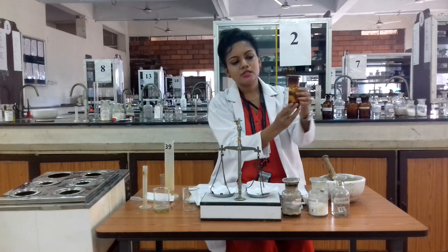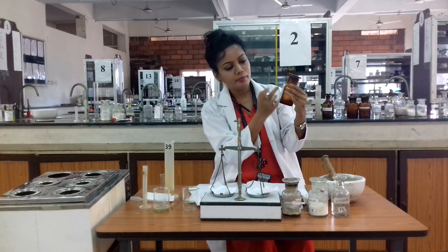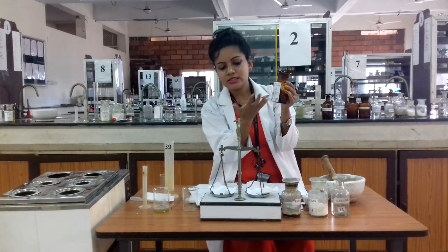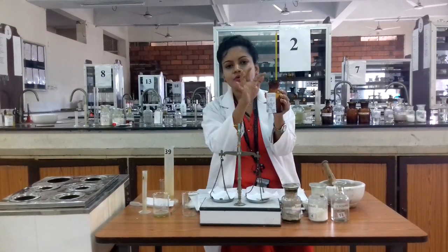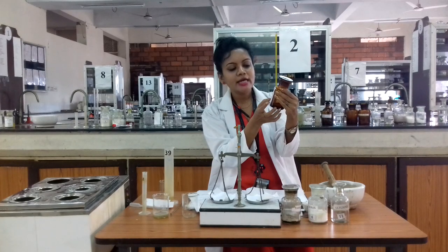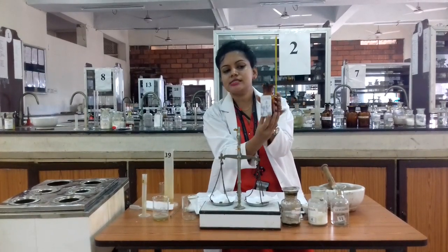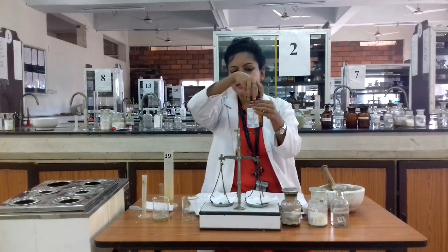Then we apply a suitable label: write 'Paint 20 ml — Not to be swallowed,' along with the patient's details. The direction for use is: to be applied over the gum with gentle massage. This completes our tannic acid glycerin paint preparation.